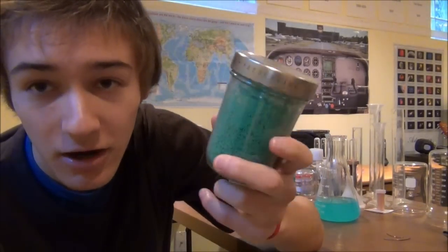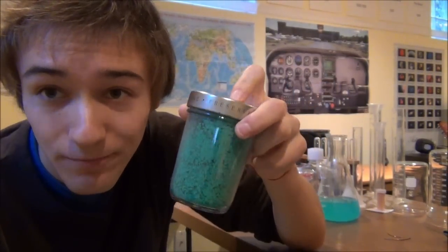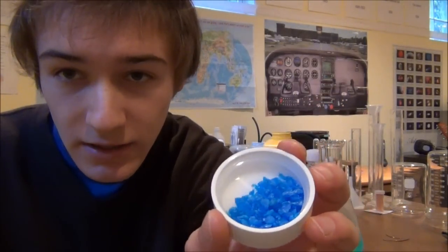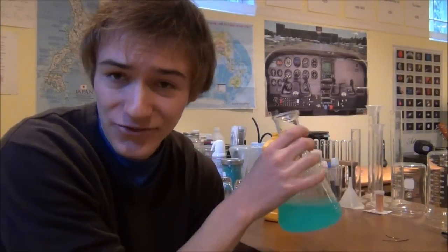This is copper carbonate which is actually a solid, it's kind of a greenish powder, and this one's probably my favorite, this is actually copper acetate. And then copper 2 sulfate itself, that is the actual solid that I've dissolved in here to make this solution, is this beautiful dark blue crystal. Really concentrated copper 2 sulfate actually has this really dark blue color and I like it even more. This is not very concentrated so it's just more of a light greenish blue color.